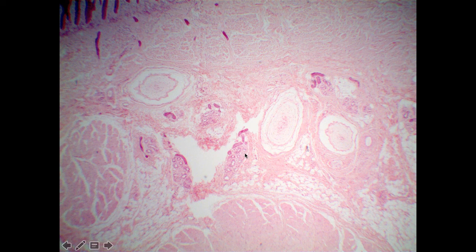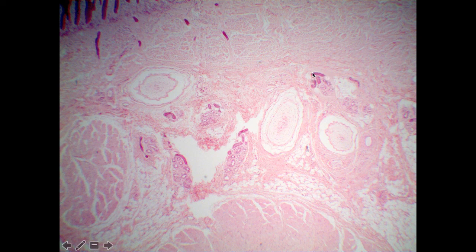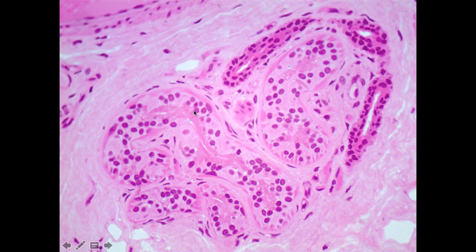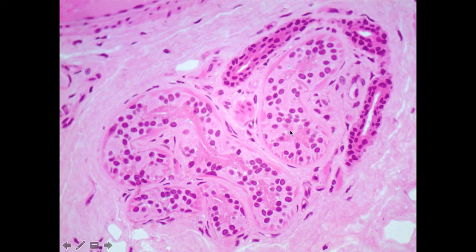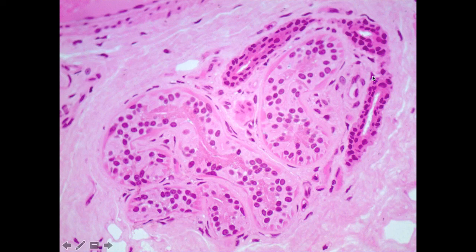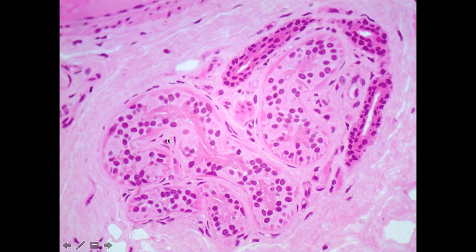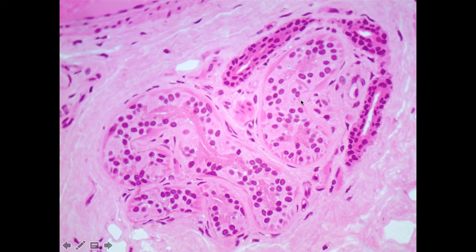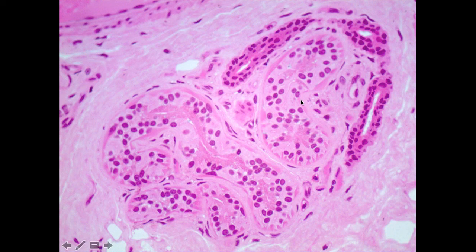Also visible in this field of view are structures that turn out to be sweat glands. When we look closely at them, they have tightly packed cells with no really obvious free surface — they almost look spiral in shape, with associated ducts. This should look like glandular epithelial tissue similar to what we saw in the salivary glands. These are sweat glands, and specifically these ones that do not have an obvious lumen are referred to as merocrine sweat glands — the glands that secrete the liquidy substance on the surface of your skin when you're hot or sweating, or to the palms of your hands when you're nervous.